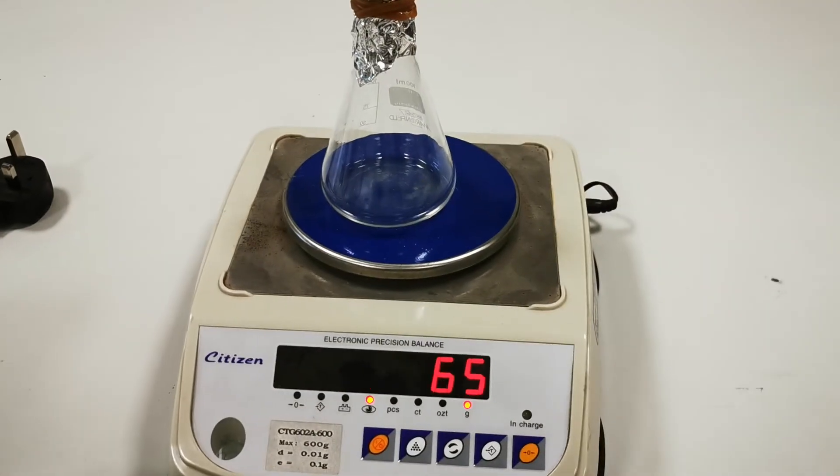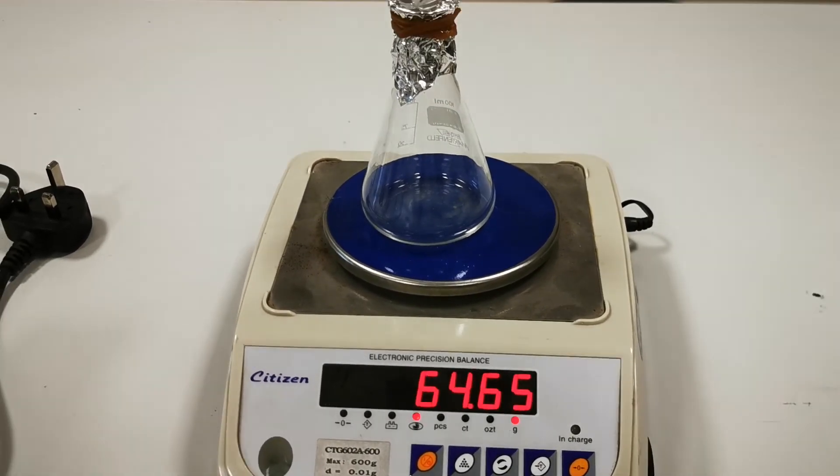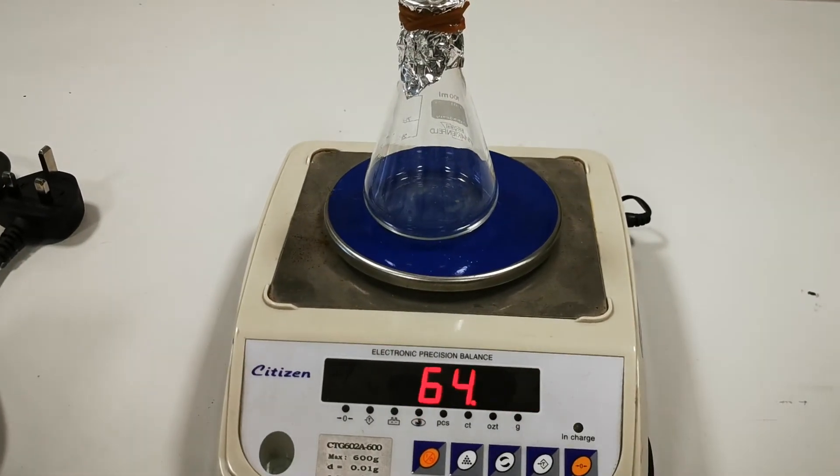And now, the final step is measuring the mass of the gas in the Erlenmeyer flask. After the measurement, now you can begin with your calculations.